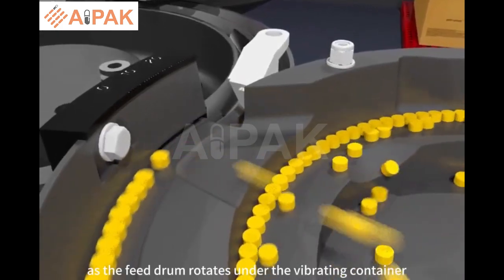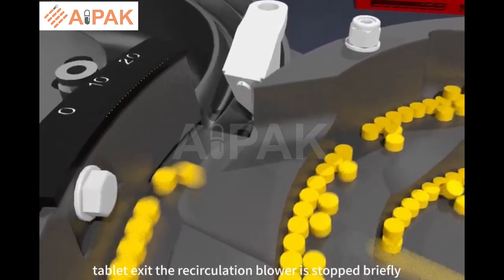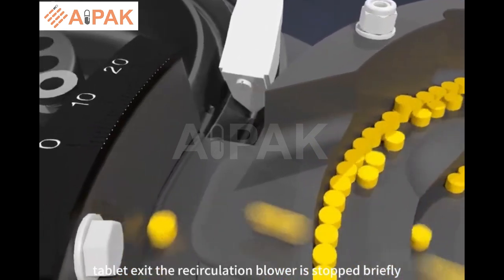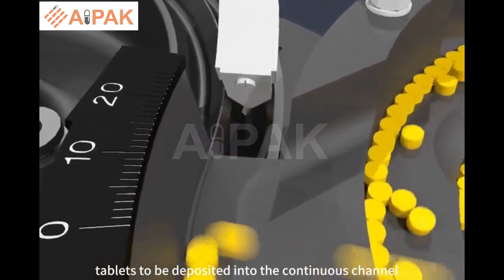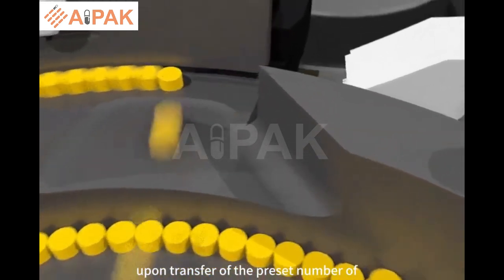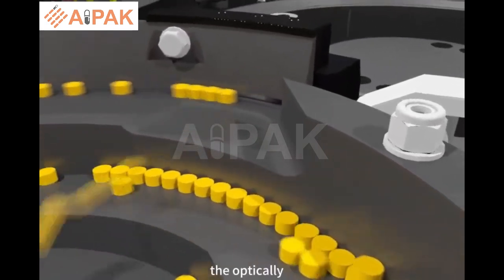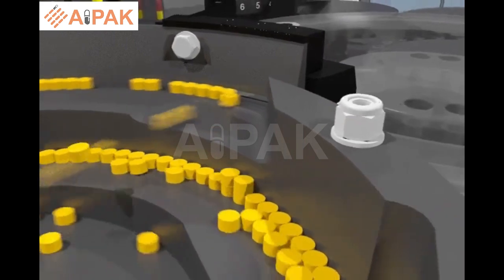As the feed drum rotates under the vibrating container tablet exit, the recirculation blower is stopped briefly to permit 1 or more tablets to be deposited into the continuous channel in preparation for dosing. Upon transfer of the preset number of tablets to the drum, the optically controlled blower resumes tablet recirculation.